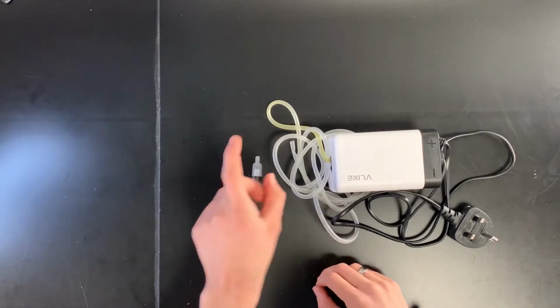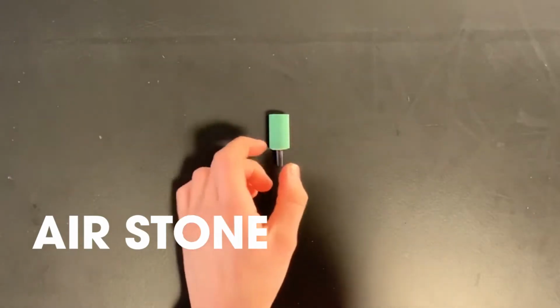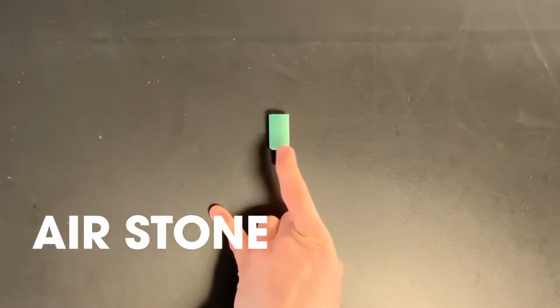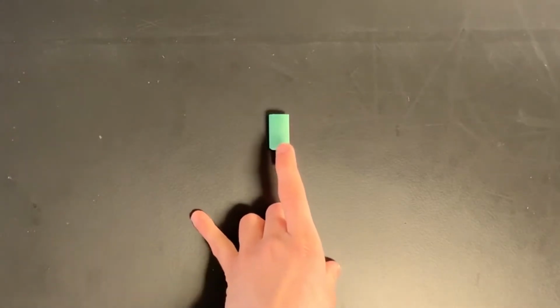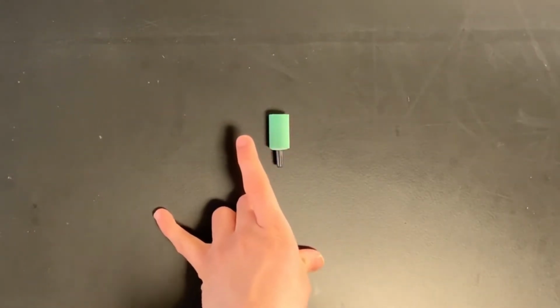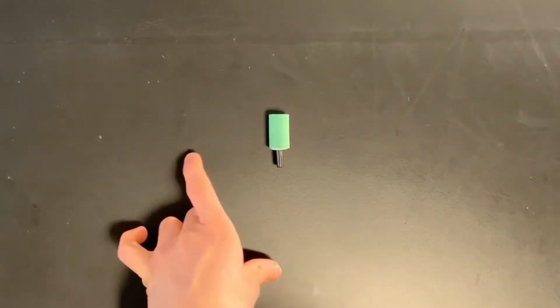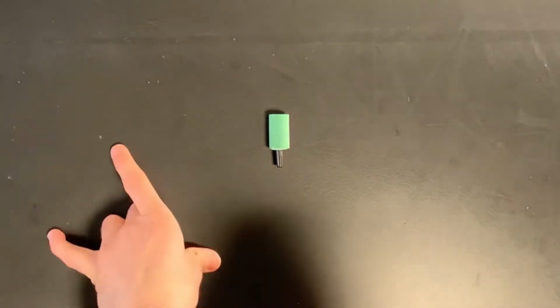Then the third thing that we need is one of these. This is an air stone. So this basically is a piece of stone that has loads of holes in it. And this essentially means that instead of having one big bubble going into the hatchery, we're going to have lots and lots of little bubbles. And that's really good because it means that we're going to get more oxygen into the water, and that's going to be really good for the brine shrimp. Okay, so how are we going to put this together?